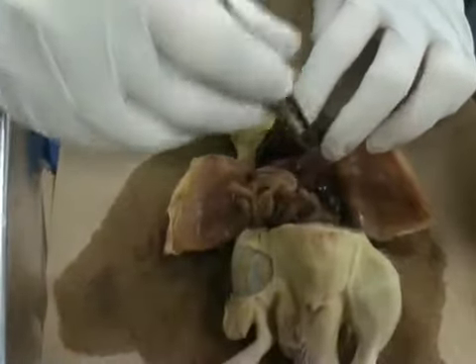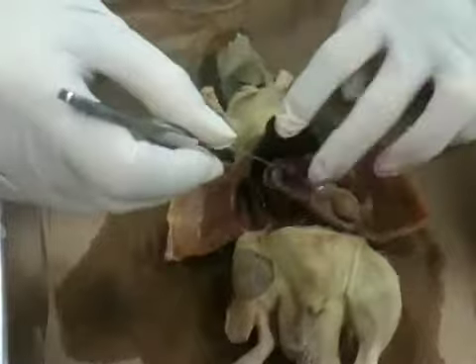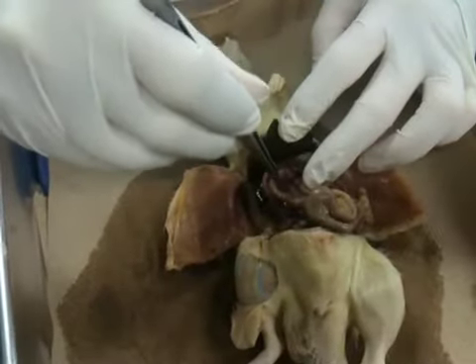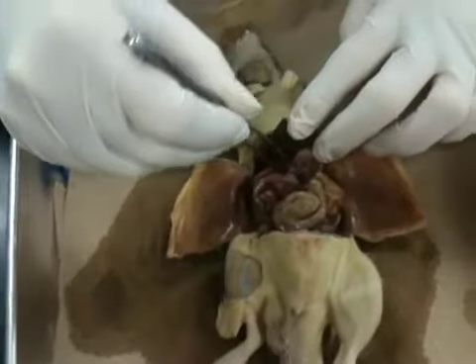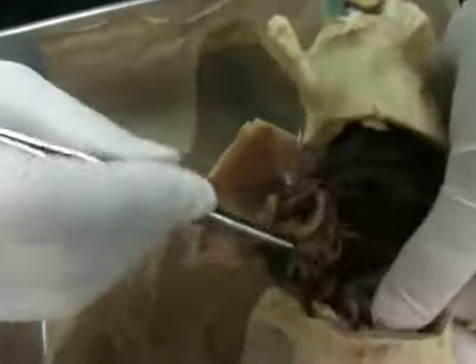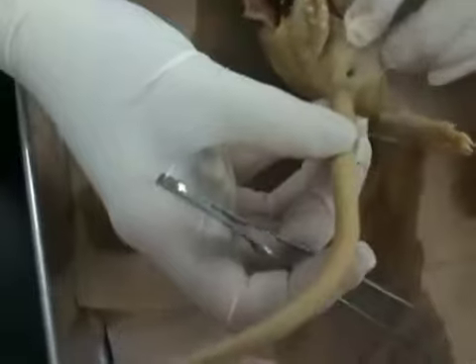Then you see this brown cottage cheese stuff. That's what I call it. Brown cottage cheese stuff. That's your pancreas right there. So when you're looking for the pancreas, right there. So there's some more, right? Here's some more right here over by the stomach. That is pancreas. Right there. The descending colon goes down into the rectum, and then of course the anus is right there underneath the tail.